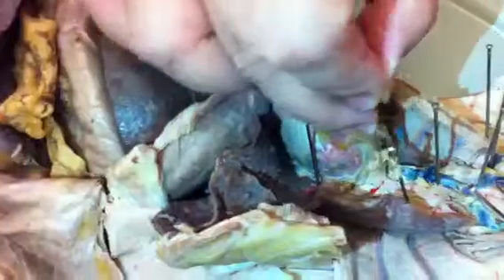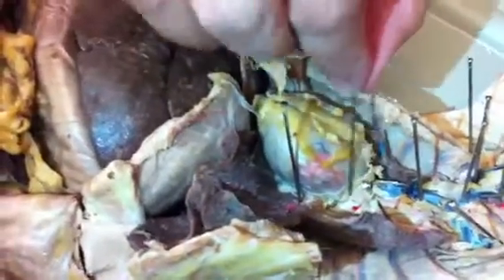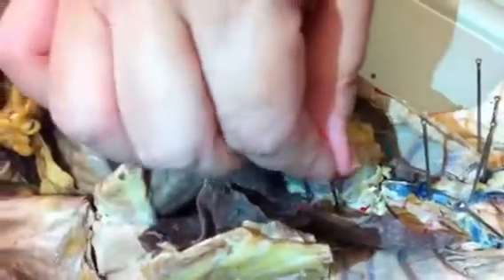Over here, actually we've got to start the other way, right? We do the other flow the other way. Right here is the aorta. There's the arch, right there. Ascending would be on this side. It ascends and comes up to the arch. And then the arch, if descending, we can call it the descending thoracic once it's in the back here.